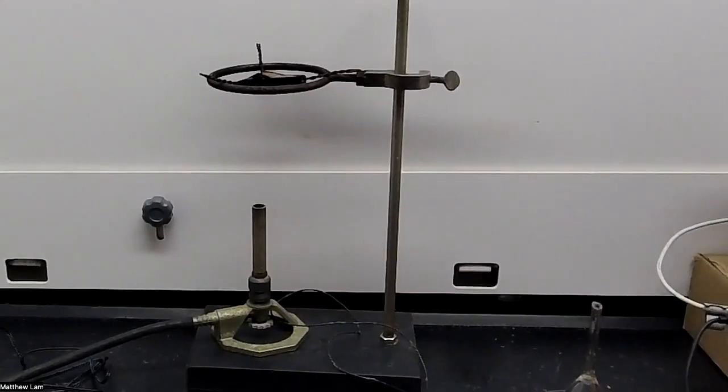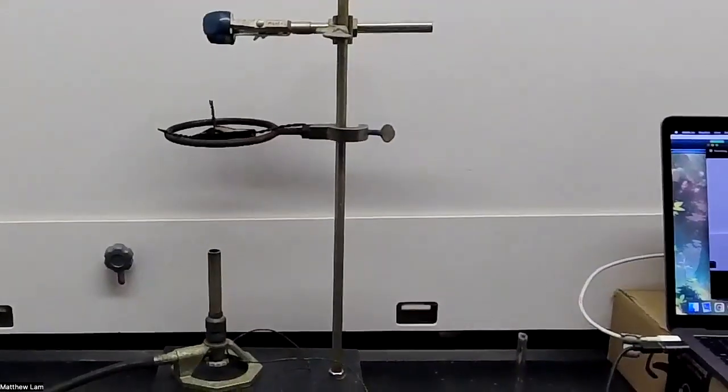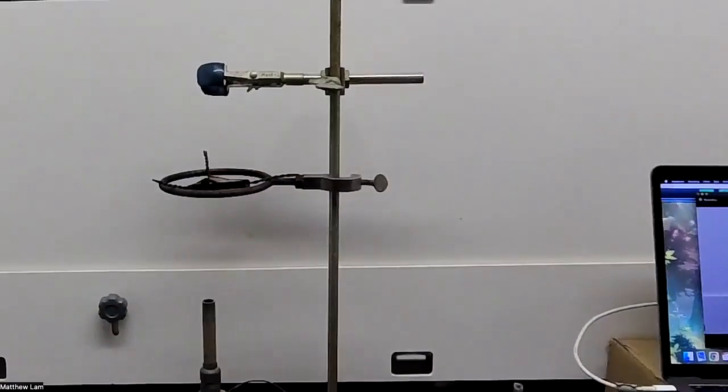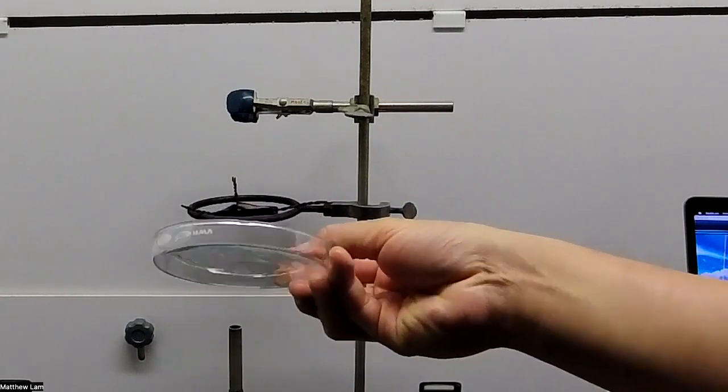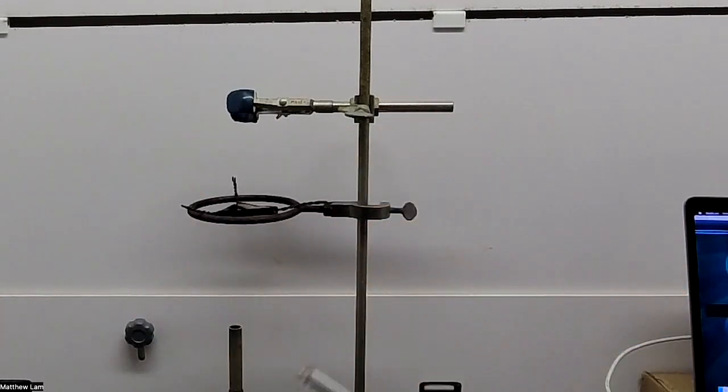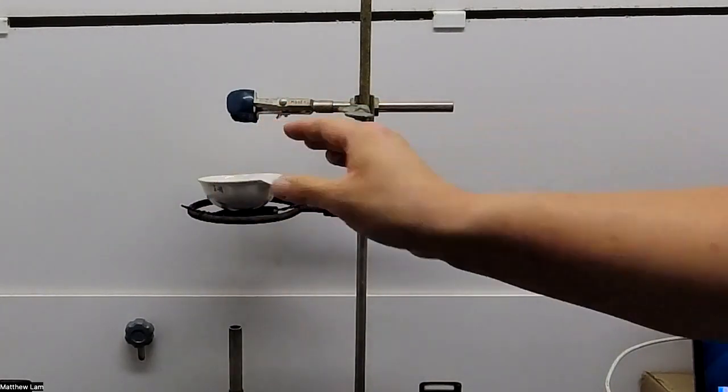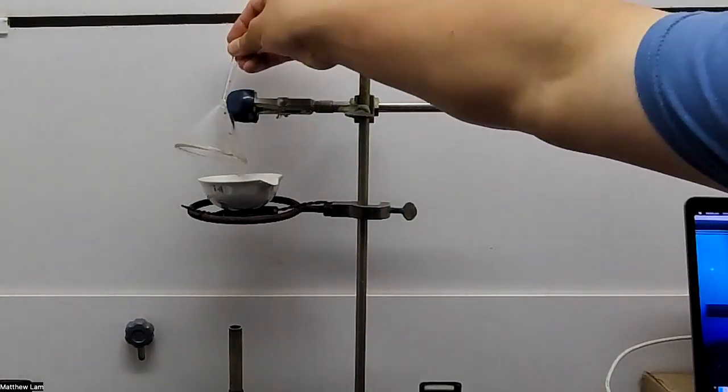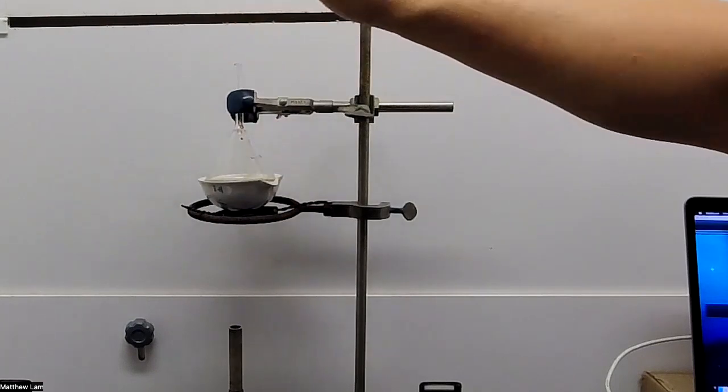Now, let's see if I can move this back a little bit so you can see the whole thing, hopefully. I'm going to omit most of the Bunsen burner, but we're going to set up our apparatus now. The Petri dish is just to carry your funnel after the experiment is finished because the funnel will be hot. So I'll put our evaporating dish with ammonium chloride on there and then I'll add in our funnel to catch the sublime ammonium chloride.